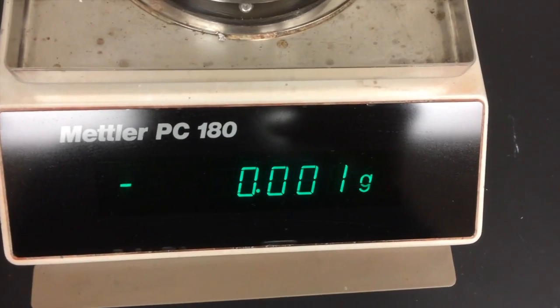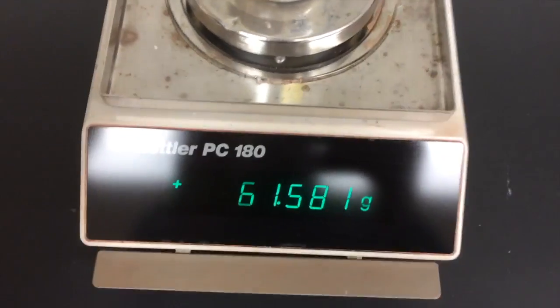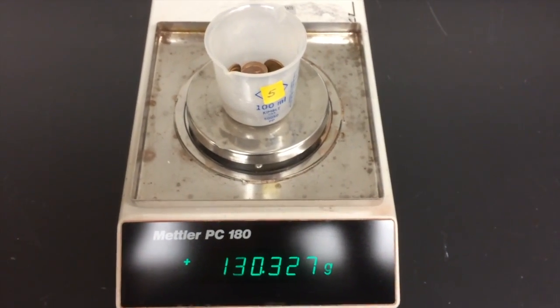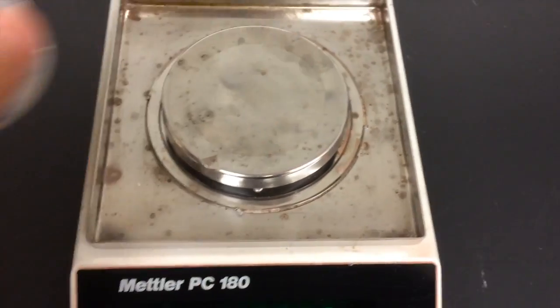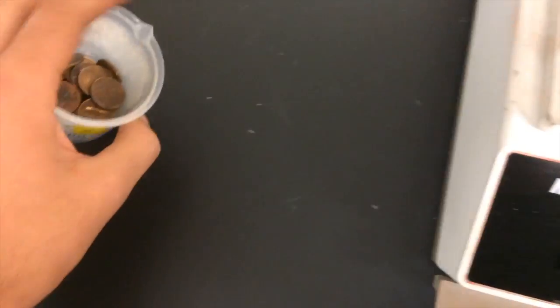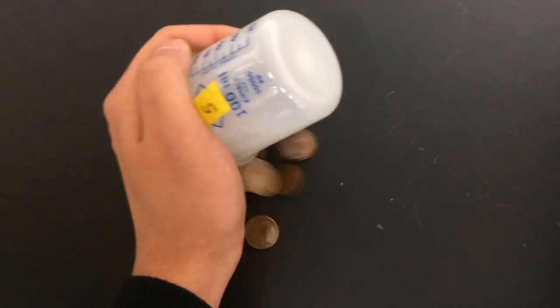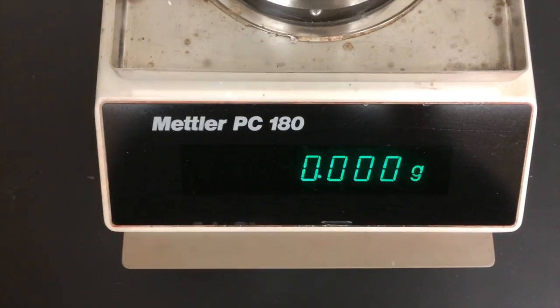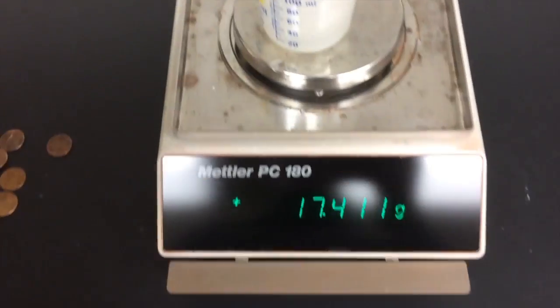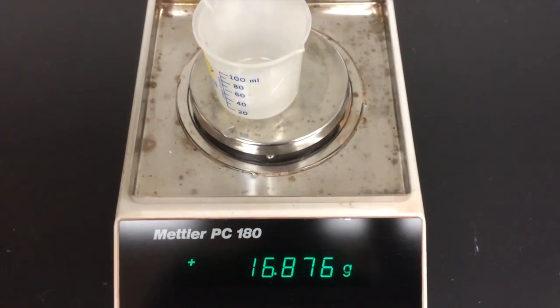Start by finding the mass of all 40 pennies. This works by taking the pennies inside your beaker and recording that mass, and then taking your pennies out of your beaker and putting that onto a counter, and then recording the mass of your empty beaker. By subtracting the mass of your empty beaker from the mass of your full beaker, that should be the mass of all 40 pennies.